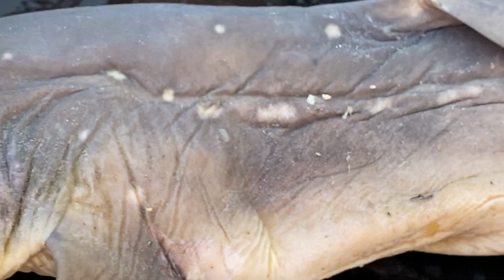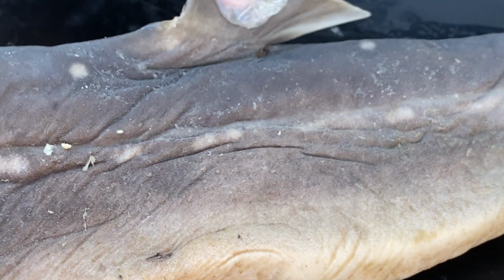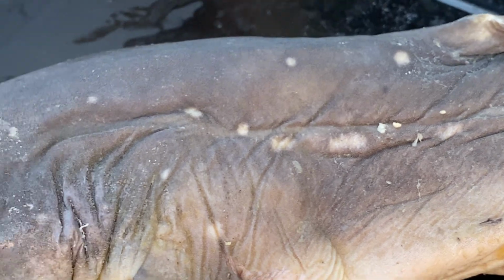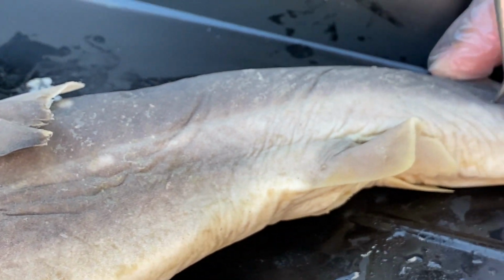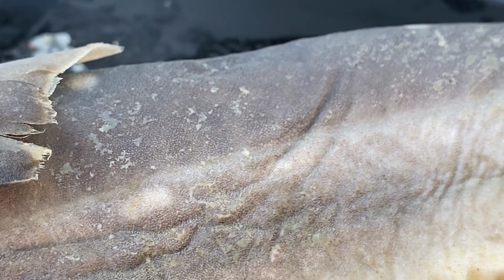On the side, another sense that we all know about with sharks is their lateral line. You cannot actually see a distinct line like a snook has, but there is a line of pores extending from the head and going all the way down the side of the body. These pores are connected to the nervous system. There is a gelatinous goo on the inside of them that has a neuron coming into it. And this lateral line is picking up two different things. It is picking up vibrations through the water, and it is also picking up pressure changes.